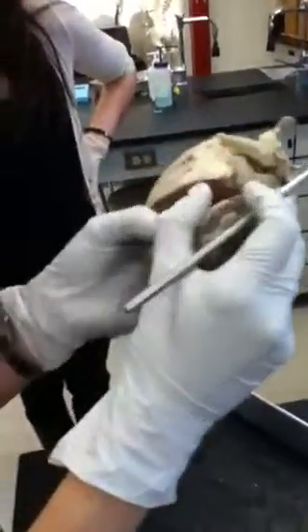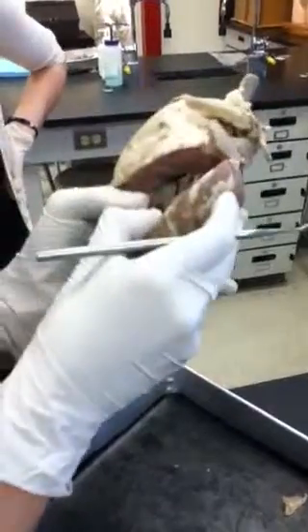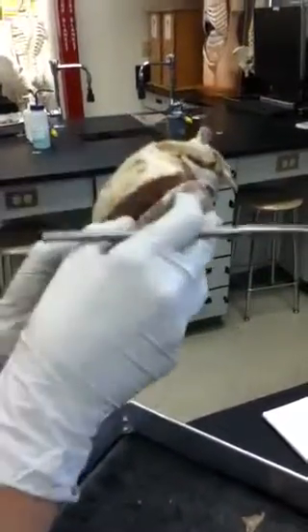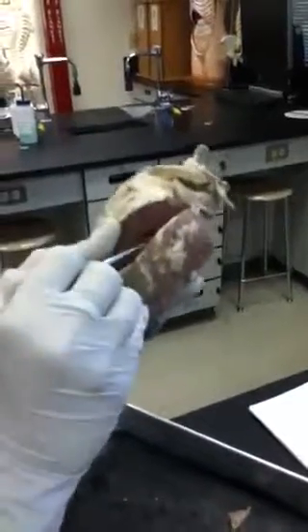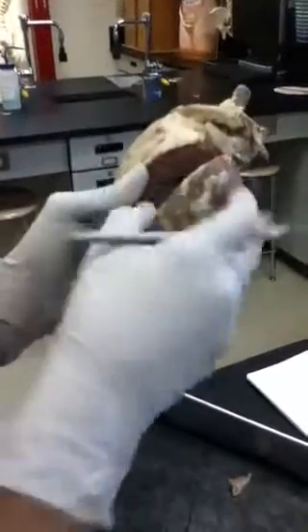Then it comes through which valve? From the left atrium to the left ventricle, it's the bicuspid valve, or the mitral valve. Only two flaps this time, bicuspid valve. So there's only 2 flaps instead of 3 like the tricuspid valve. Tri and bi. Then it also is connected to the wall of the left ventricle through the chordae tendineae. The cords are attached to the wall via the papillary muscle, just like in the right ventricle.